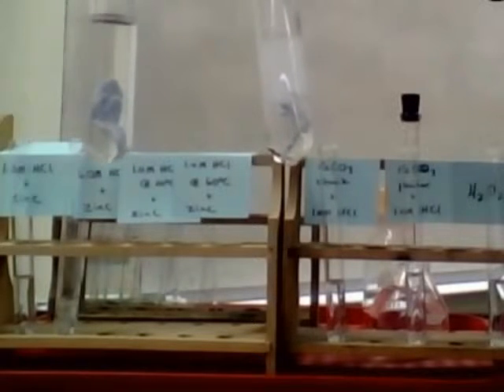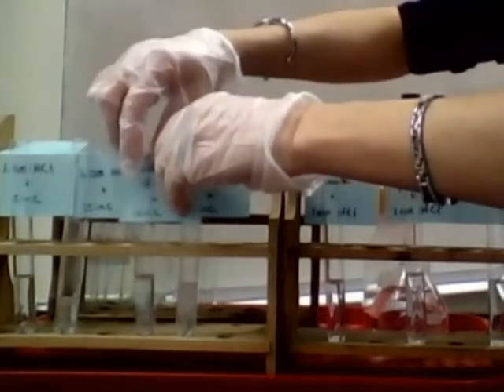And so same reaction. So we're seeing bubbles as our sign of chemical change here. And notice the one on your right is, well, the tube looks a lot cloudier, and that's because there's a lot more vigorous bubbles coming off. So I'm going to pull it up closer versus this one here. So bubbles on both, but the 60-degree one's going a lot faster, producing bubbles a lot quicker.